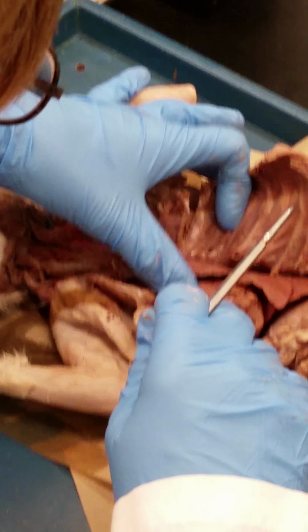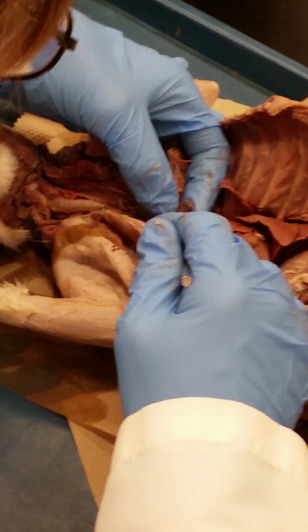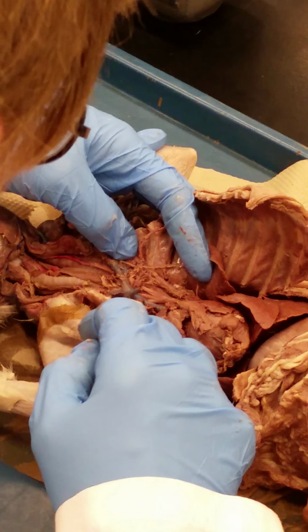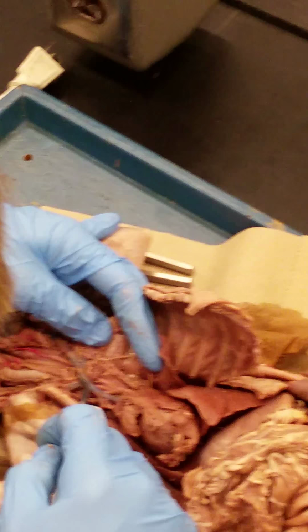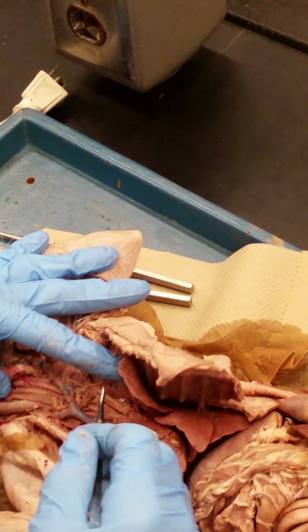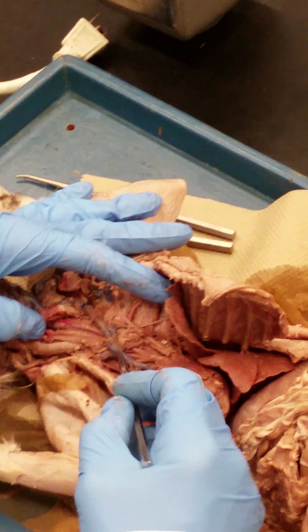Let's do the veins. Okay, you just ignore that little common trunk of the mammary vein if you see it. I will not ask you that. So we're going to start with the anterior or cranial vena cava. It's coming back into the right atrium. As soon as it branches, these 2 branches are called the brachiocephalic veins. Okay, so these are all veins. Did I say artery? Veins. And this brachiocephalic vein, we'll follow it on the left here. It's going to branch 3 times.